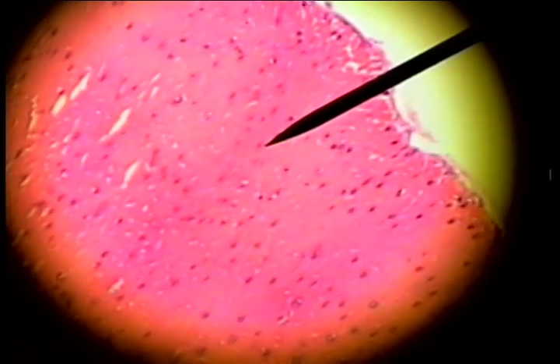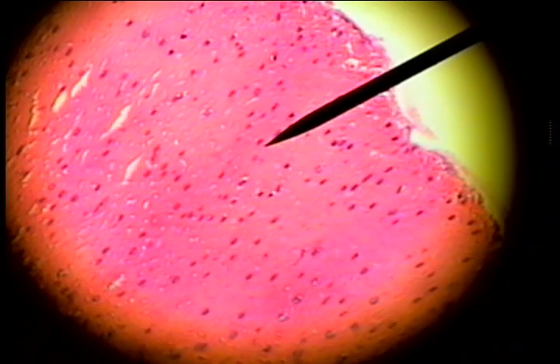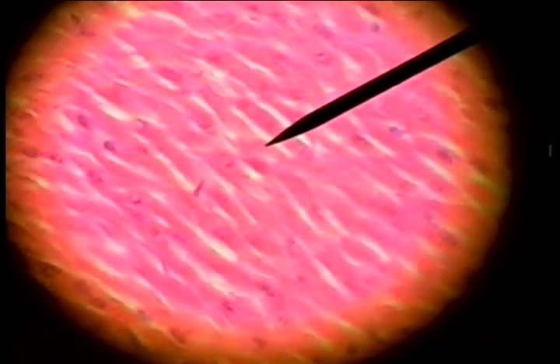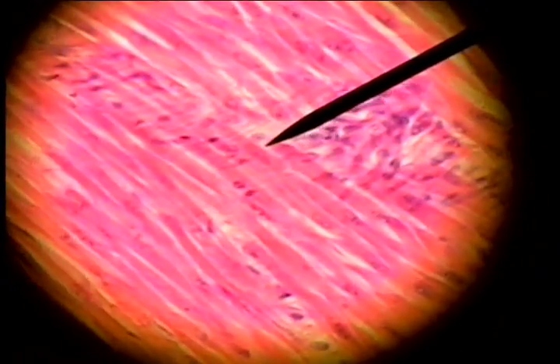This is a cross-section of smooth muscle with the cross-section of each individual smooth muscle cell, the nuclei in the center. And if we go down into the longitudinal section, or lengthwise section, we can see that the smooth muscle cells are oriented here with the spindle-shaped cell.